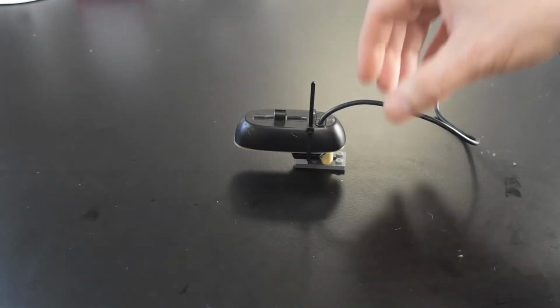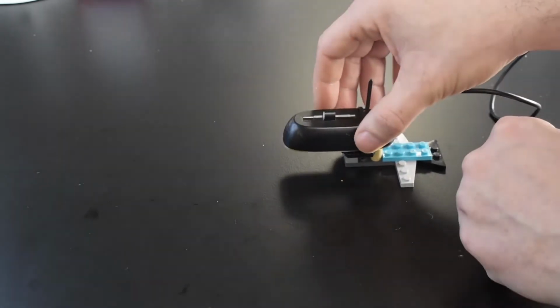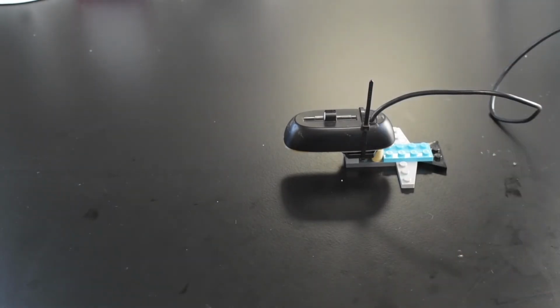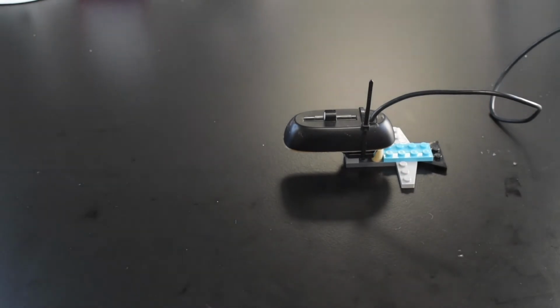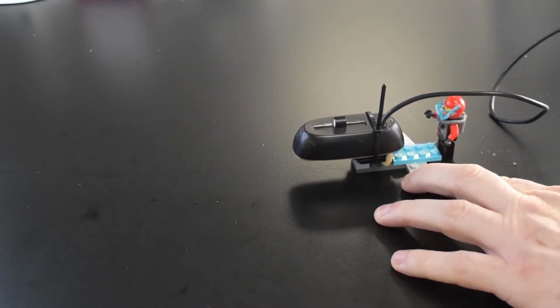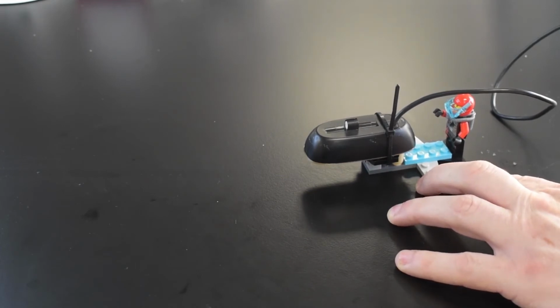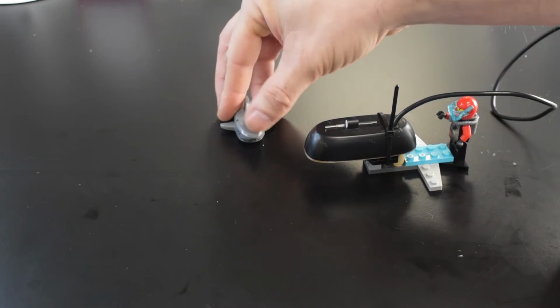It's not the most stable thing in the world, it's a bit wobbly, but because it's Lego, all you need to do is just add whatever extra little bits you want to give you something much more robust and stable, and then that'll allow you to look at any sample you want, give you a nice close-up view of anything that you want. And just to finish off, keep in the theme, we'll add a little diver there, and sure, why not, have a Lego shark. Rawr.